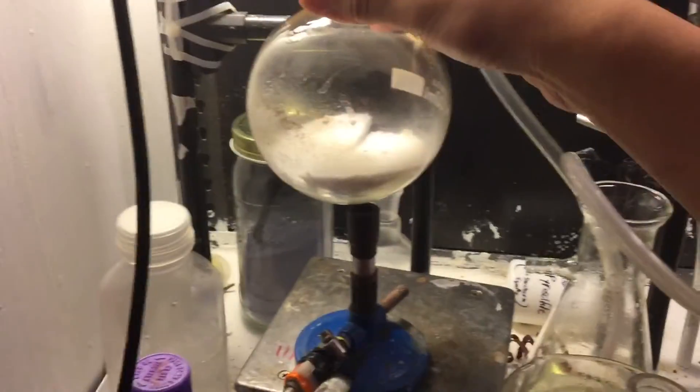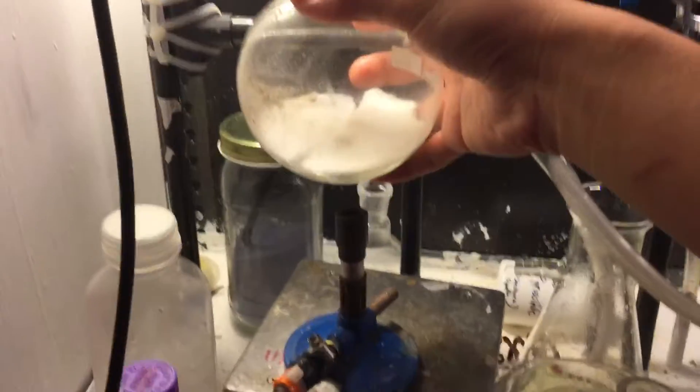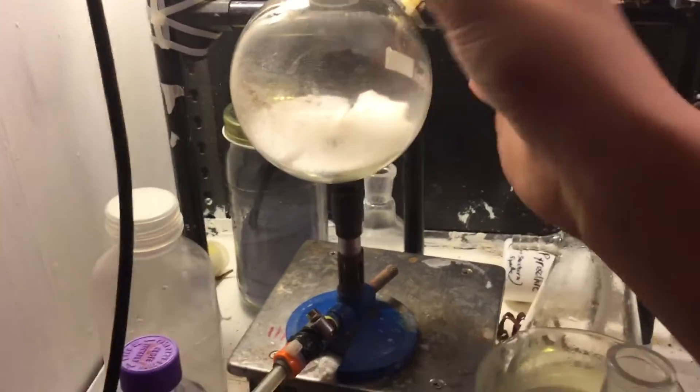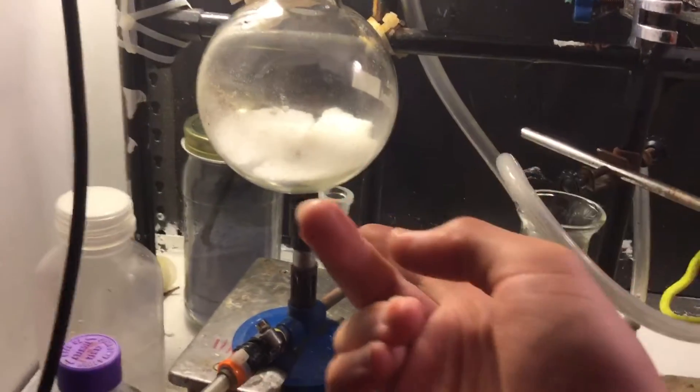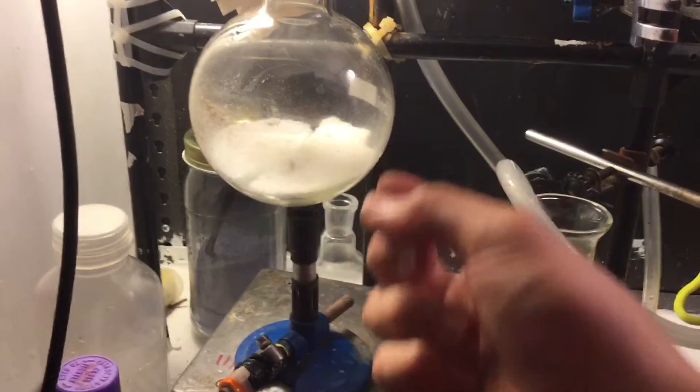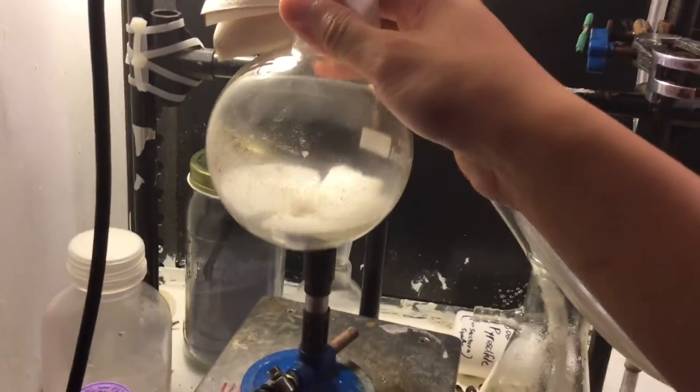This is just a giant block. I suspect that's probably just still sodium pyrosulfate, although it was quite impure when I made it. There's probably some sodium sulfate and other stuff in there that shuns the production of the SO3.